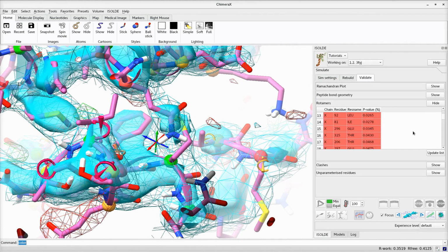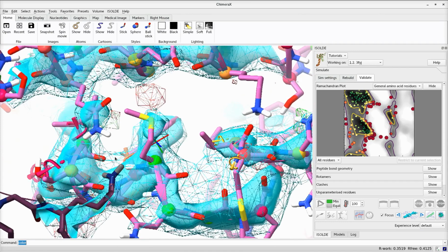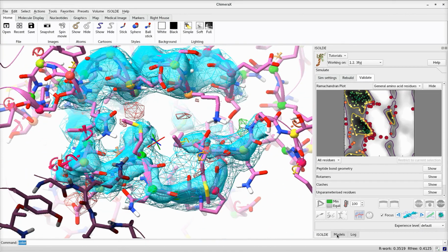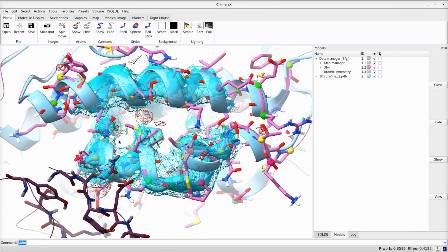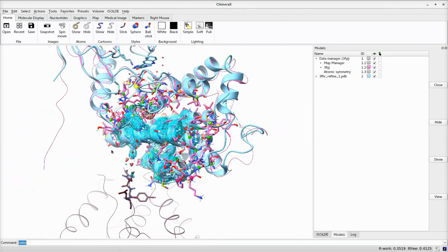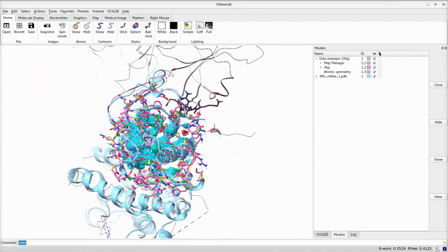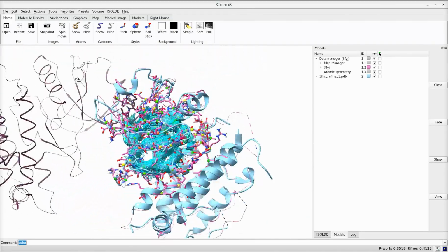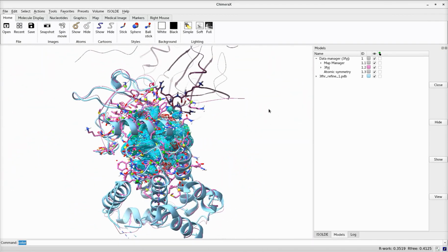While correcting these errors manually would be quite time-consuming, here I will be making use of the 1.9 angstrom model of a 75% identical homolog, 3FHR, to quickly correct the majority of the problematic sites. Note that as deposited, 3FHR itself contains some correctable errors, but given the much higher resolution, these were straightforward to correct with modern methods. The reference model shown as a cyan ribbon here is 3FHR after rebuilding and re-refining.